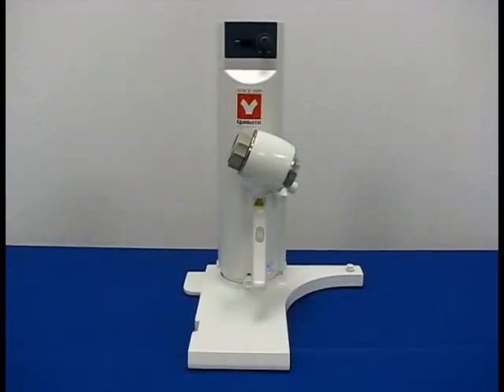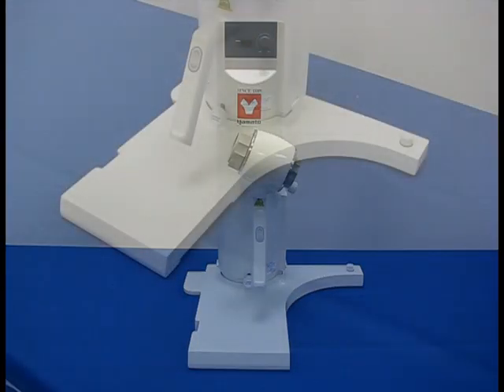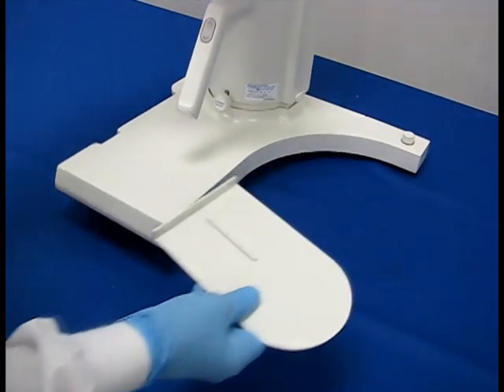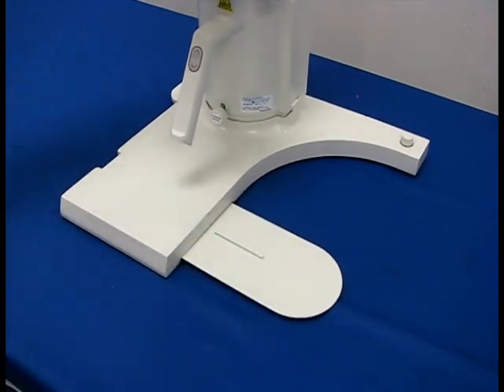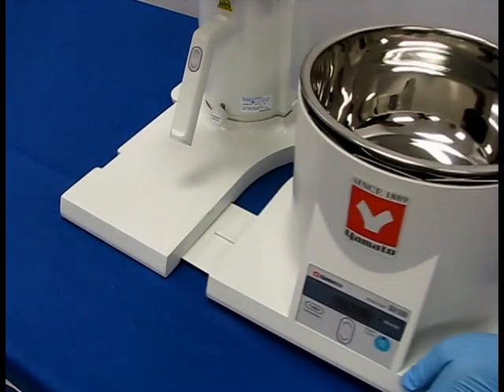Begin the installation by setting up your Rotary Evaporator on a flat, level surface. Insert the bath plate into the slot located underneath the base of the main unit, then set the bath alongside the base.